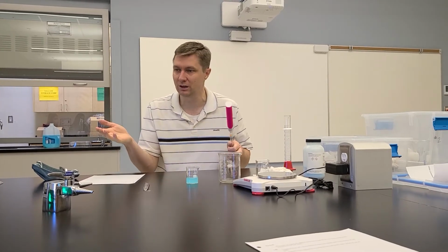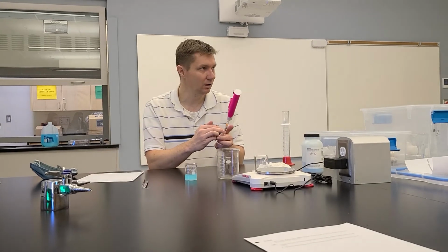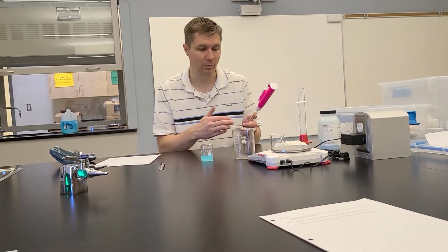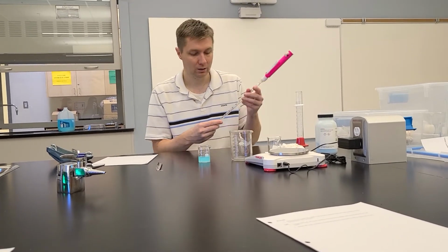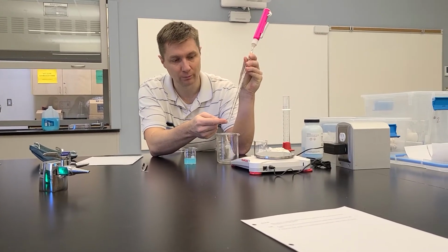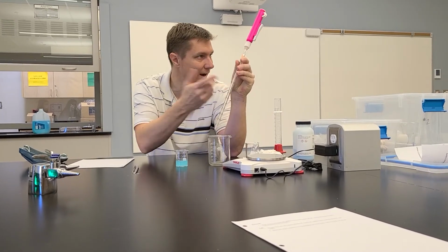If the number that you calculate, which it will be, is larger than 10, then just pipette 10, and then pipette another amount, whatever that is, added together, right? So if you're going to pipette 12 milliliters, then pipette 10, and then pipette 2 more. And with this, you can see on the number scale here, to go 2 more milliliters, you would go 9 is 1, and 8 is 2, right? The numbers just go backwards.